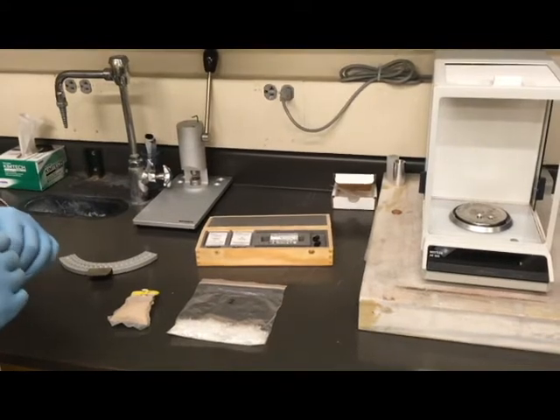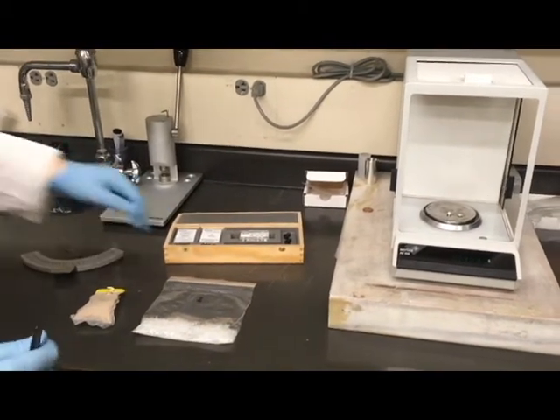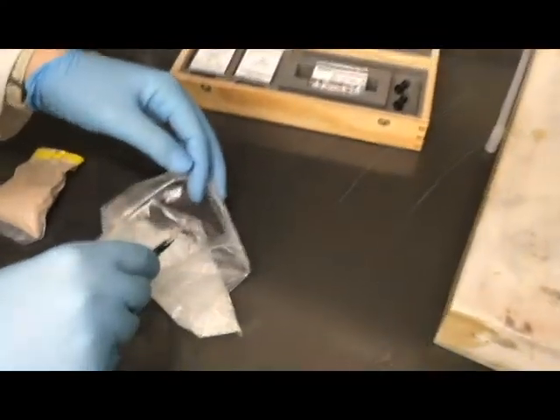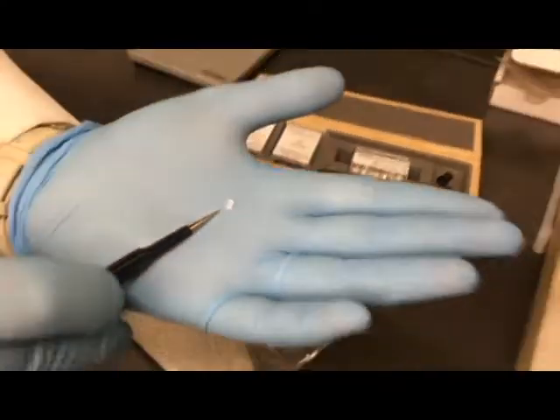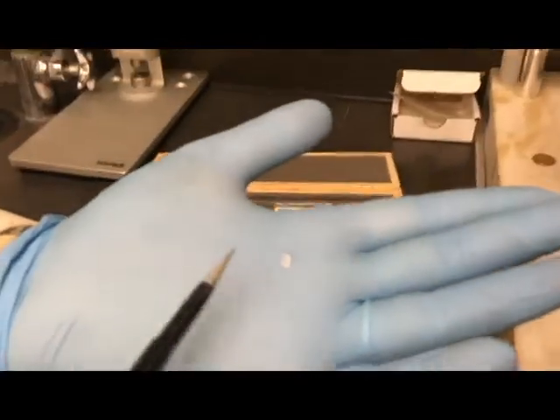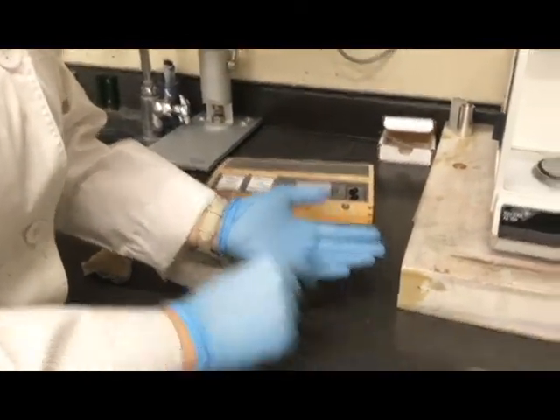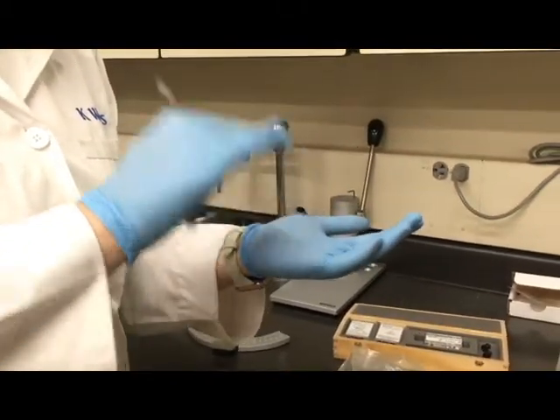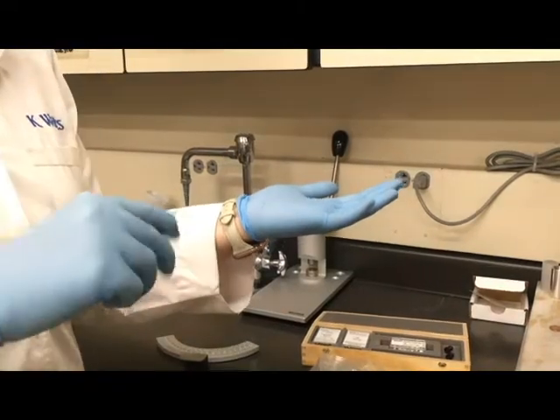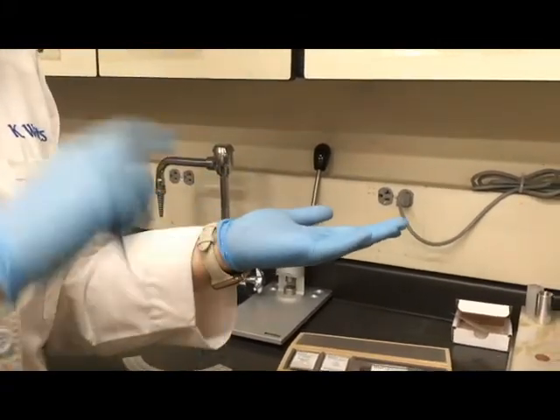Let's say we've got a pellet material — this is a polymer. I'm going to grab one in a tiny little pellet form. You can see it's mostly cylindrical but has a sort of flat spot on the side. We're going to place the flat side down inside the crucible. The reason is twofold: the heat comes from below, so to make sure our sample is heated as uniformly as possible, we put the flat spot down. Also, the DSC sensor is on the bottom plate, so making sure we have good contact between the sample, the crucible, and the sensor gives us the most accurate data.